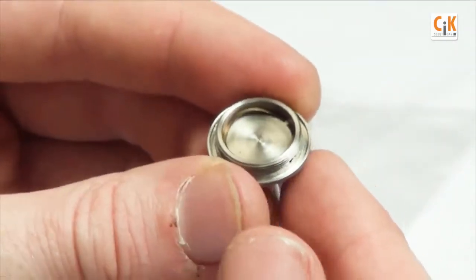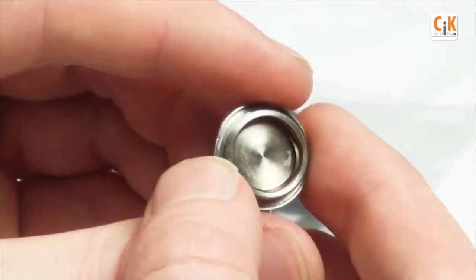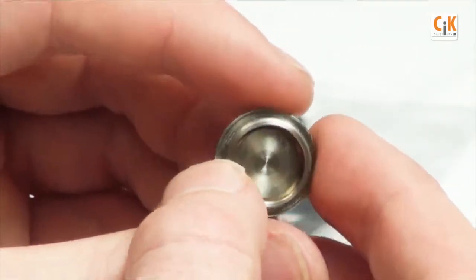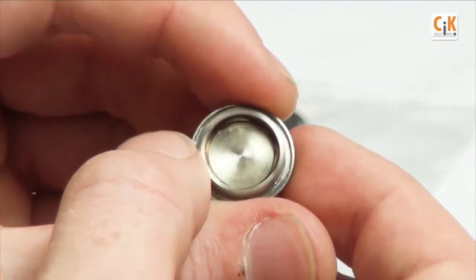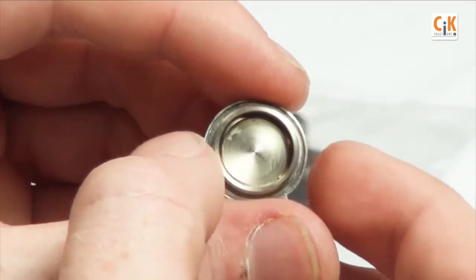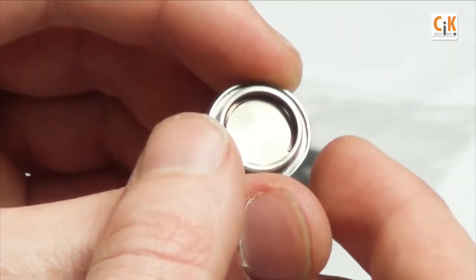Check for any scratches or nicks in the metal before reassembly. Make sure that if there are any in the sealing surfaces or if there's contamination, that you return the logger to an authorized servicer for repair.